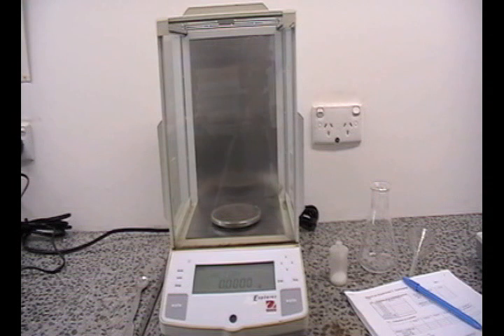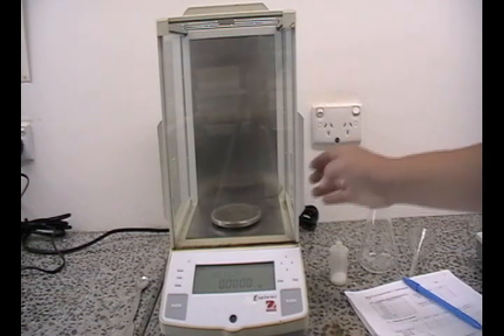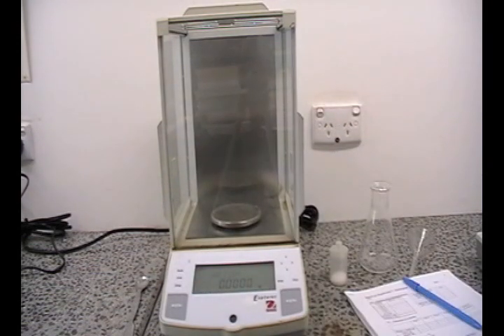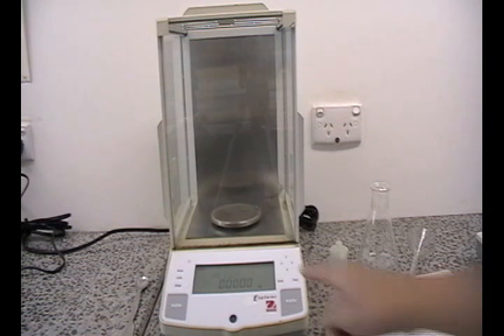Make sure that your analytical balance is clean. If it is not, consult the demonstrator for the proper cleaning technique. Ensure all the doors of your balance are closed. Once it is, tare the balance.